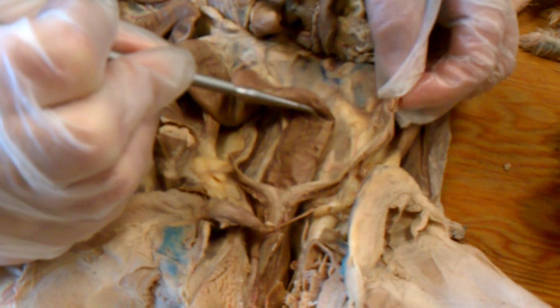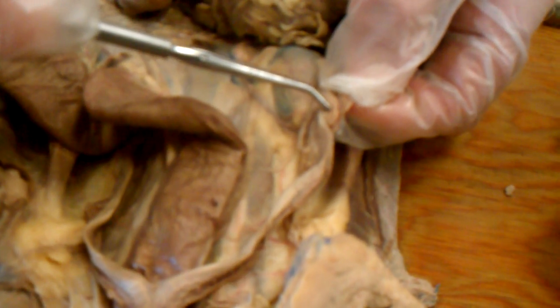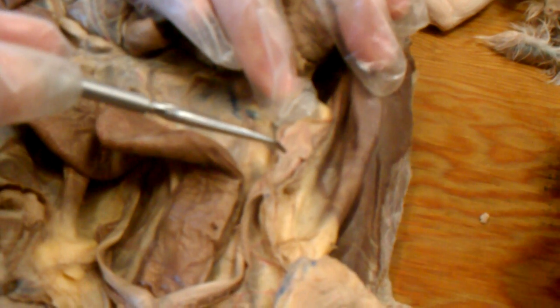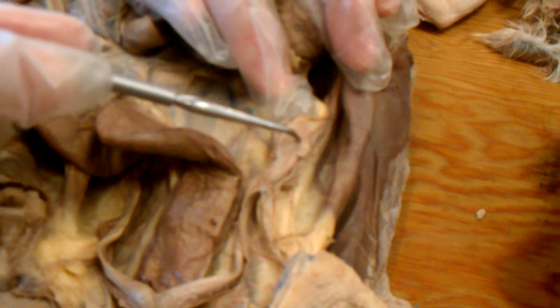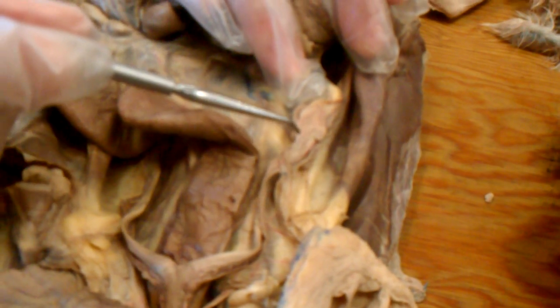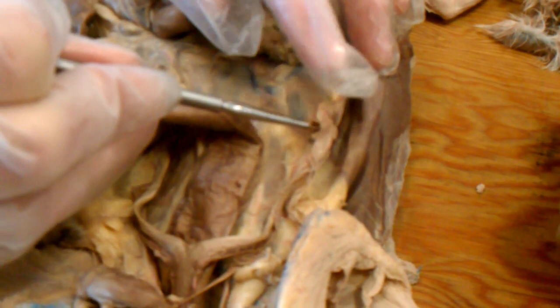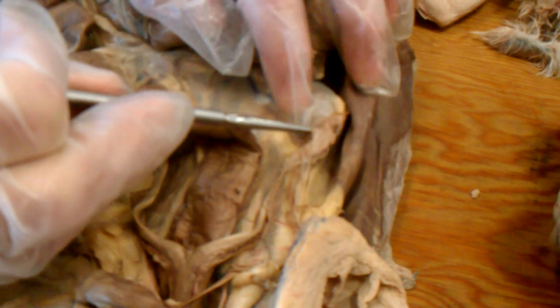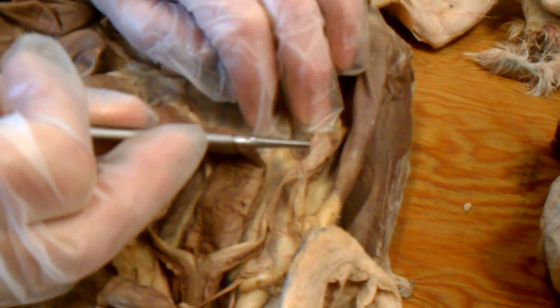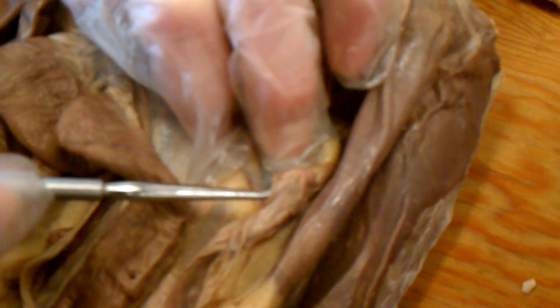At the end of the uterine horn and just below the kidney, here is the ovary, and on its lateral surface, a tube, just barely visible, curves around the ovary, and that's called the uterine tube. It's held in place by a thin mesentery. This little transparent structure is called the mesosalpinx.